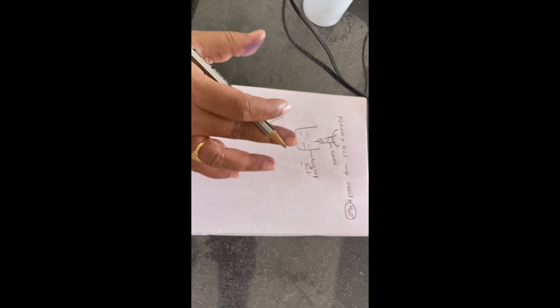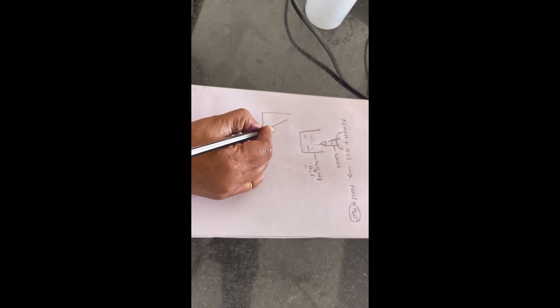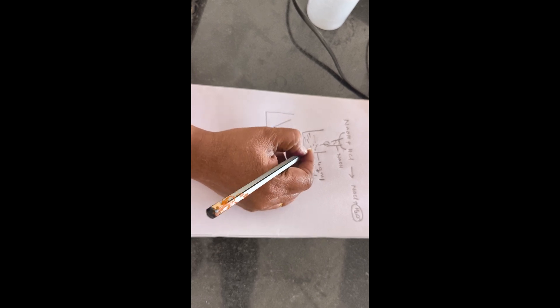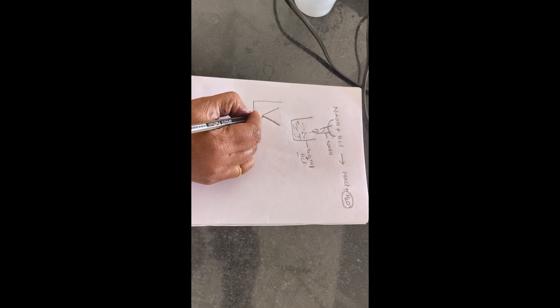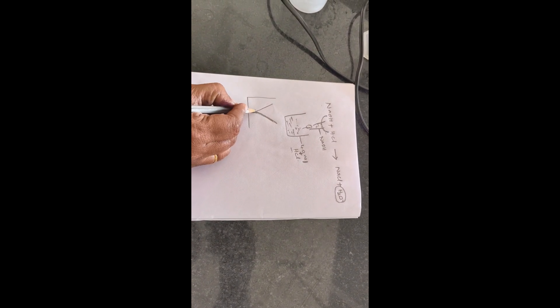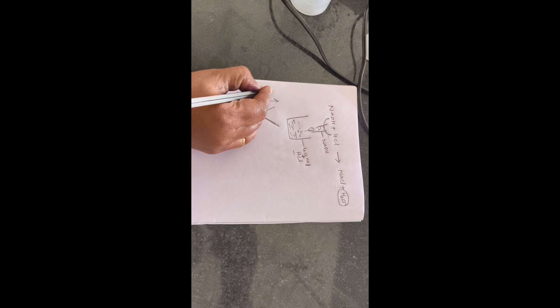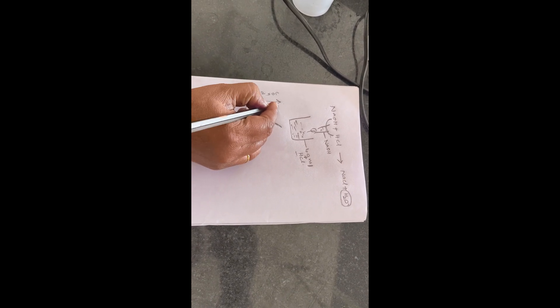After the end point or after the neutralization point, the conductance will increase again because NaOH concentration is more in the beaker. NaOH is a strong base, so the conductance increases along the curve. That is why, when we are plotting NaOH on the x-axis and conductance on the y-axis, we are getting a V-shaped curve. This is the principle of this experiment.